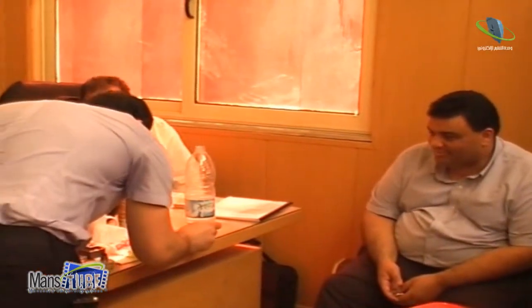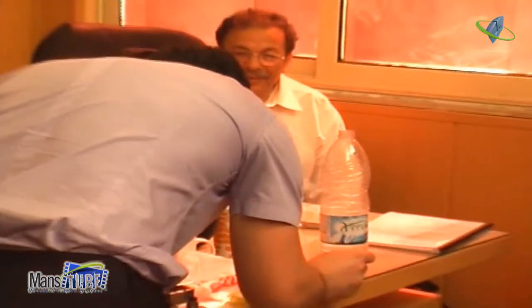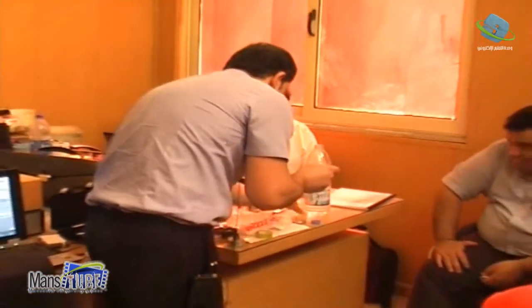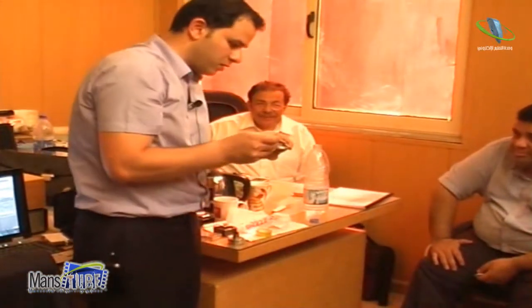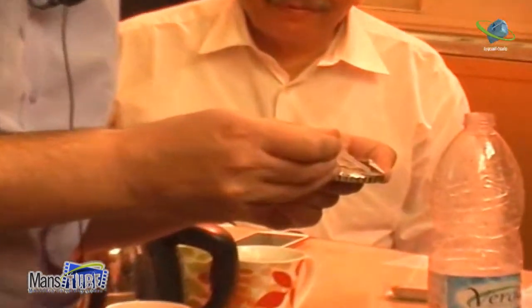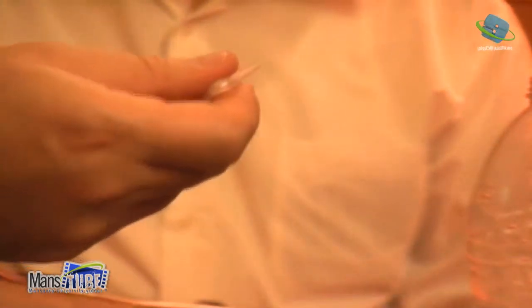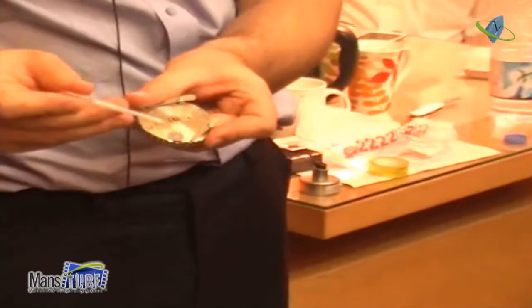I take water, okay? I take again. So what I do now, I put, let's say, water like here, okay? That's it, you see? One droplet of water. I mean, we can have a Petri dish, we can put a full water of it, you see? If I rotate it like this, you see?